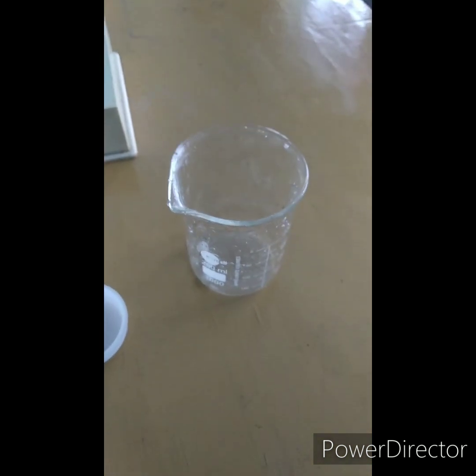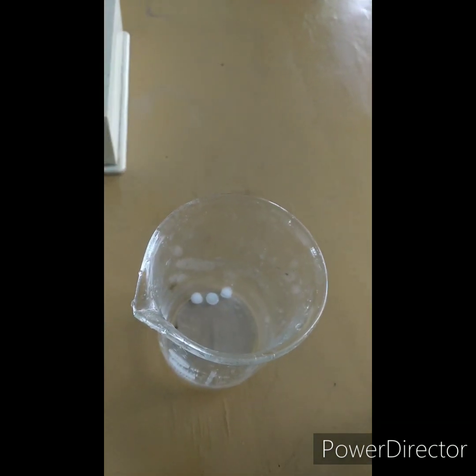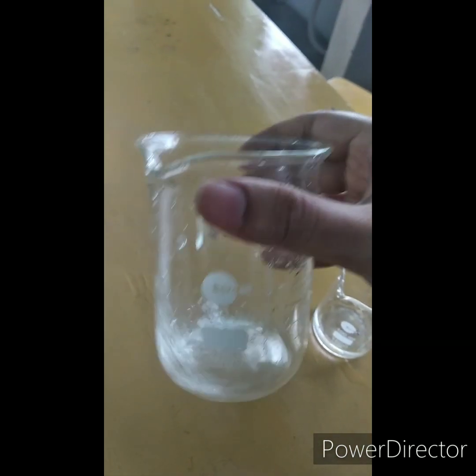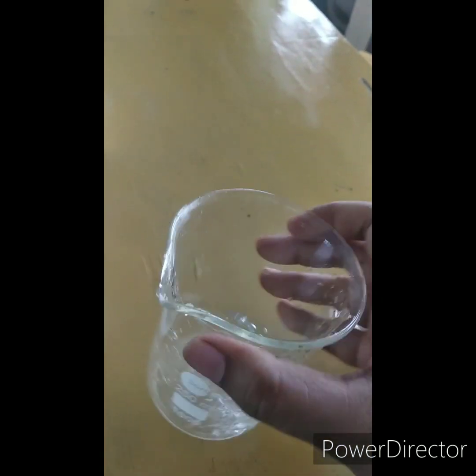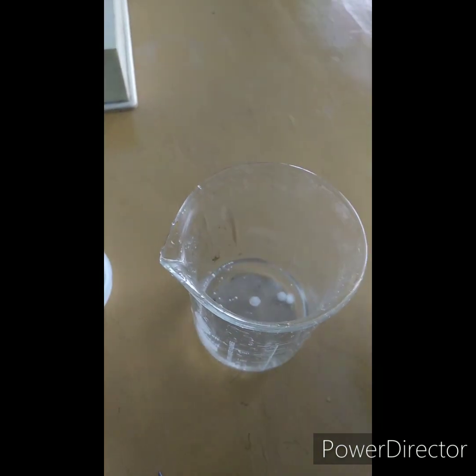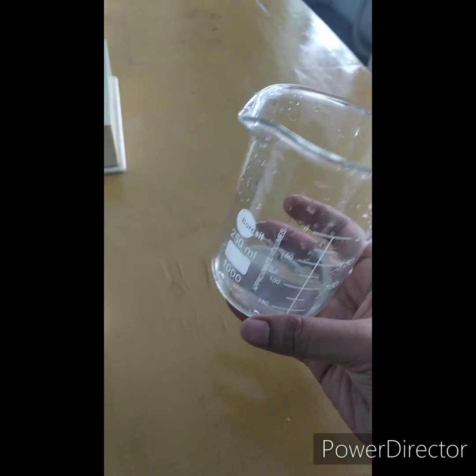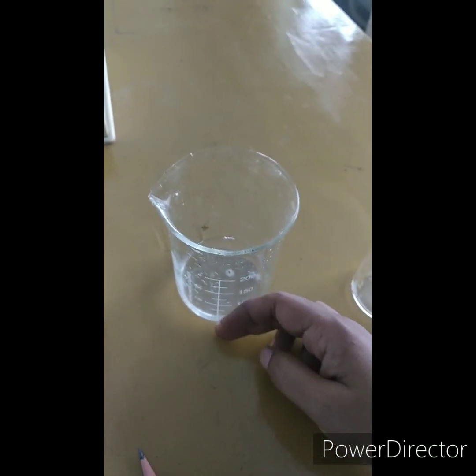Now, what happens if I dissolve it in water? I have a beaker with water. I'm pouring a little bit of water in, and now let's see — the sodium hydroxide pellets are in the water and getting dissolved.